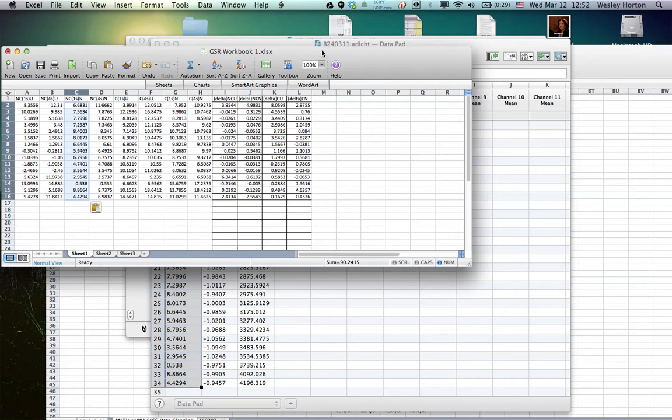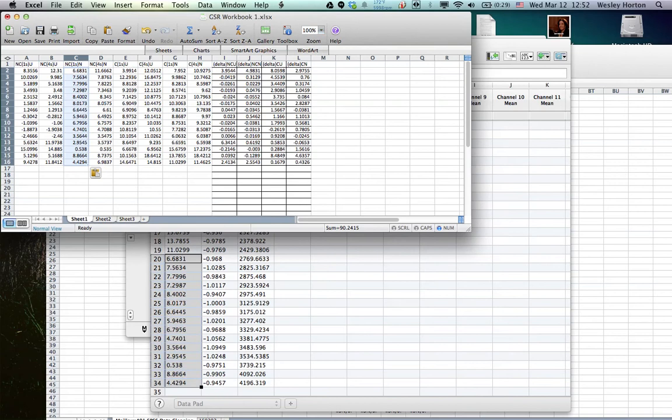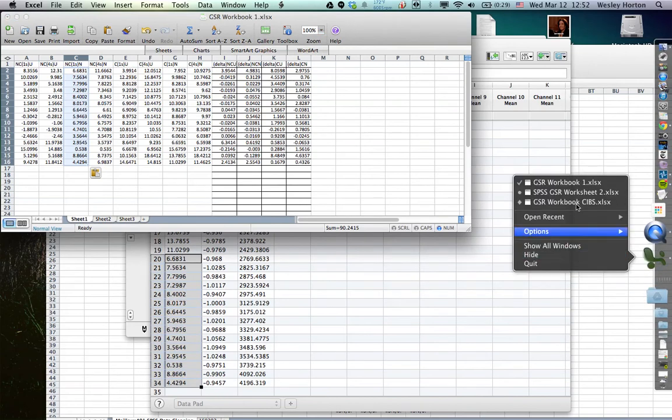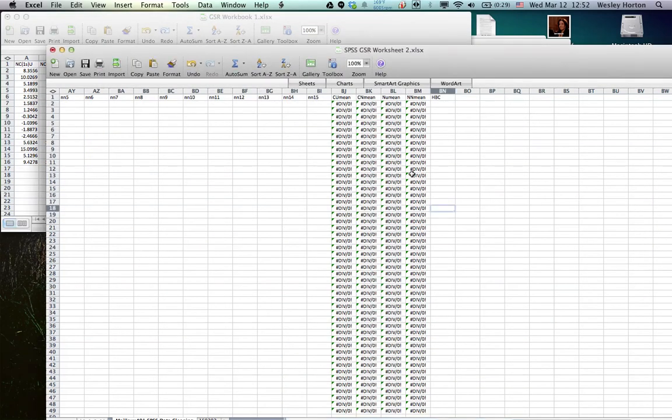So we now have workbook 1 finished. These are all the change scores for each one of these. Negative means it's a decrease between the mean and the maximum peak of post stimuli, and then positive will be just the opposite. So what we're going to do now is put it into the next Excel spreadsheet, which is going to be our GSR worksheet 2. So let's go ahead and open that. GSR worksheet 2. There it is.